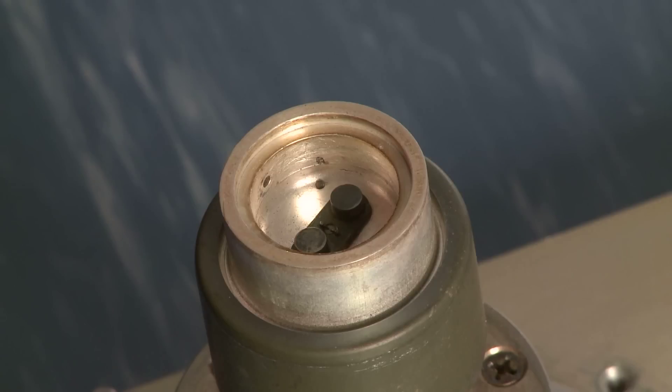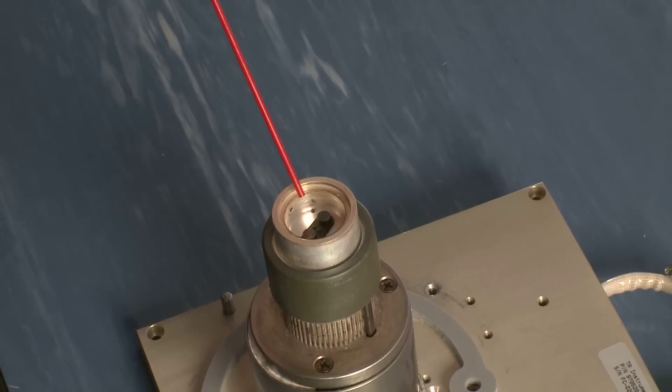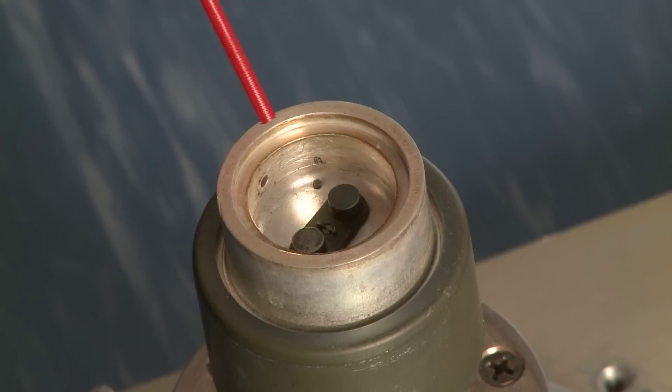The last part of cleaning with the brush involves spraying some compressed air in to blow out the bristles and debris. Very important step.